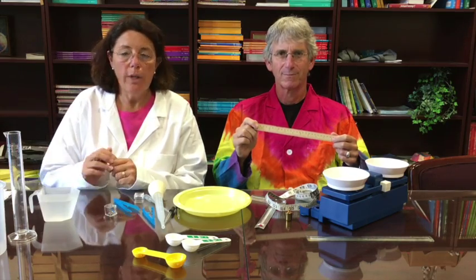To measure liquids, we have measuring cups with both US customary and metric. We also have beakers and graduated cylinders. The units for liquid measurement will be the milliliter and the liter. You'll see the milliliter capacity for the beaker or cylinder noted on the outside. In this case, we have 1,000 milliliters, which is the equivalent of 1 liter. A great reference point for students when using liters and milliliters is a 1 or 2 liter soda bottle. This helps them get a sense of how big a liter is and how small a milliliter is. Beakers are great for measuring out approximate volumes, and graduated cylinders are used when precision and accuracy are important.